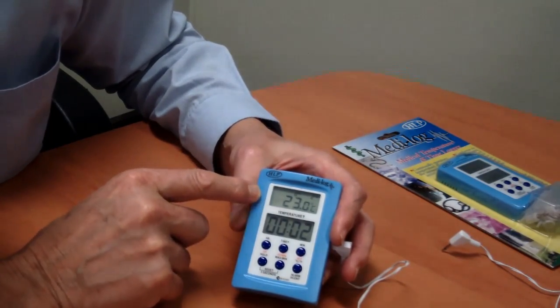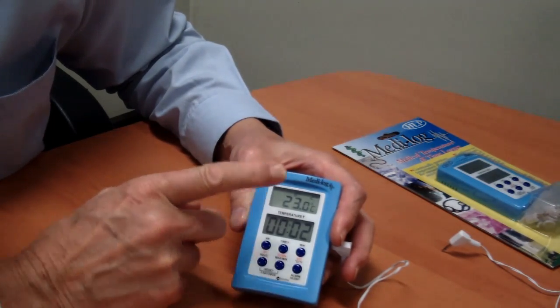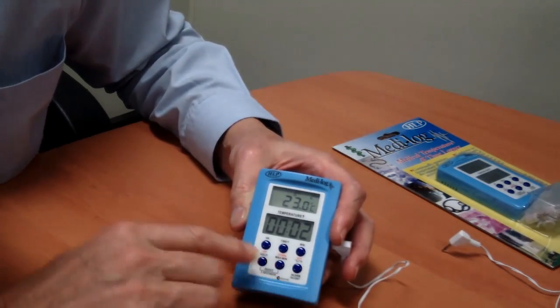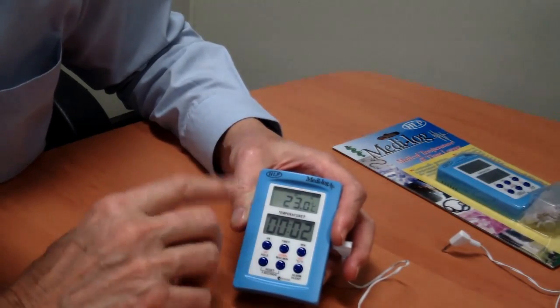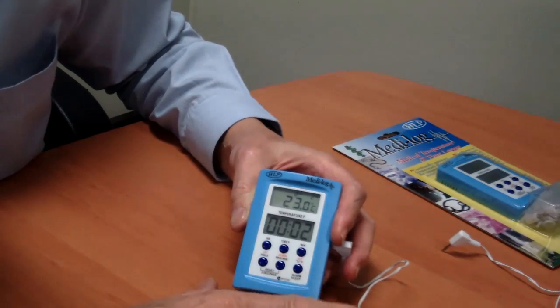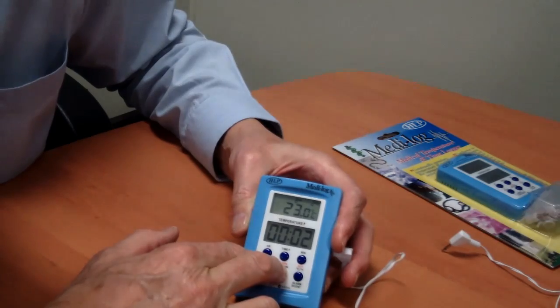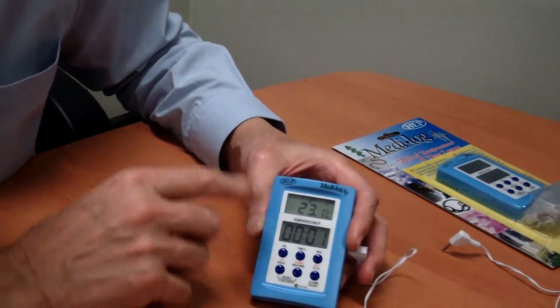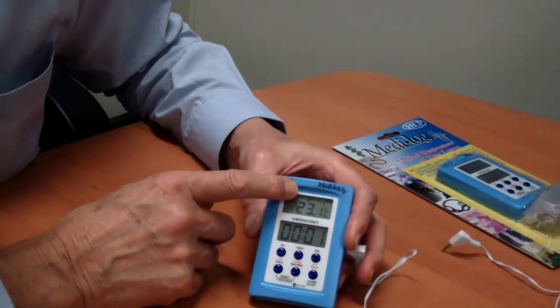What happens is if the unit is operating and the temperature goes outside the range, it will actually alarm. It flashes the high alarm LED to show you that it's actually high. It says it's 23 degrees now.